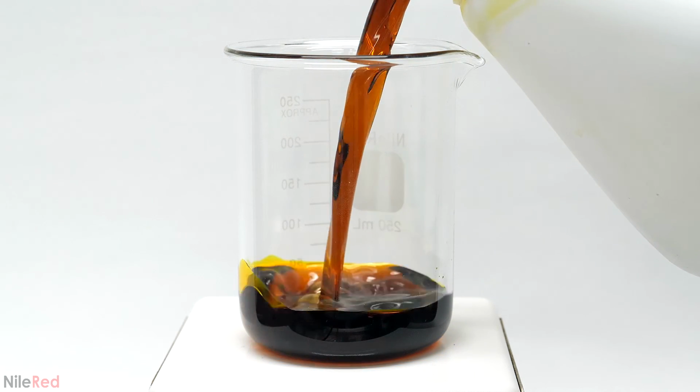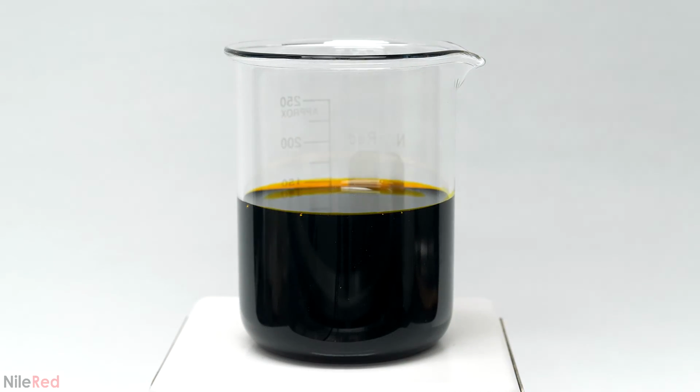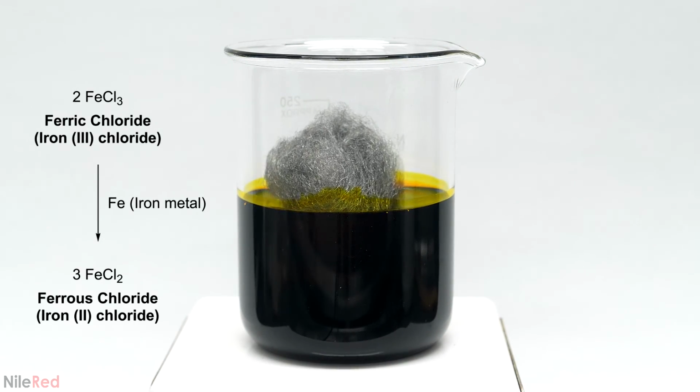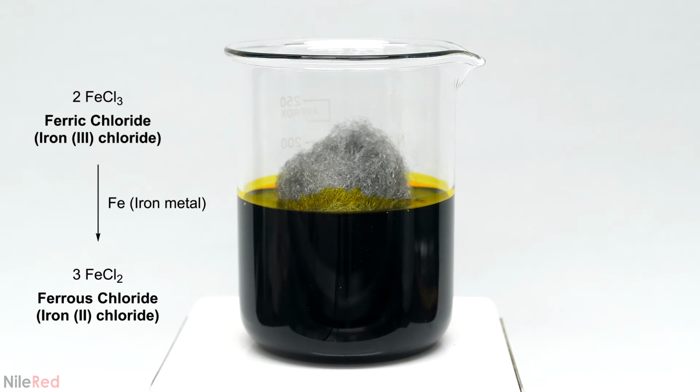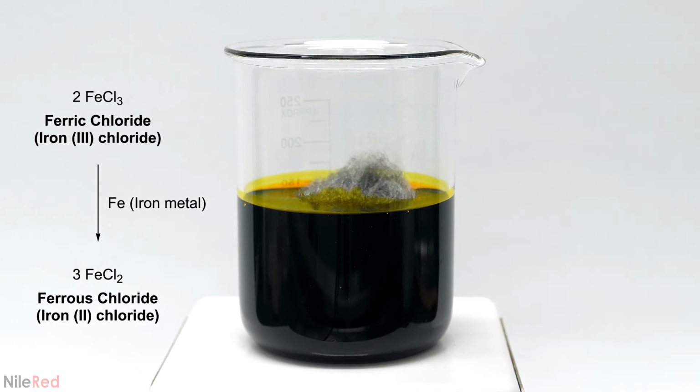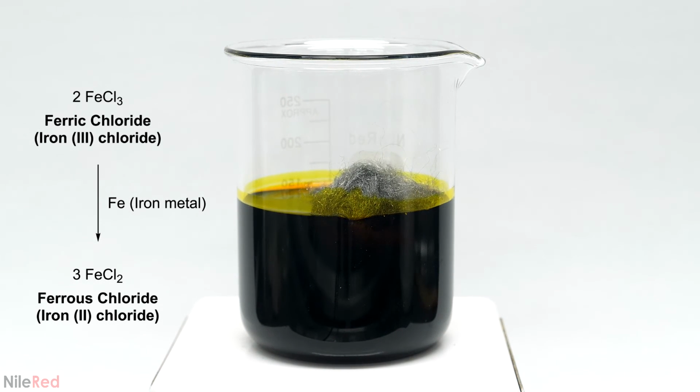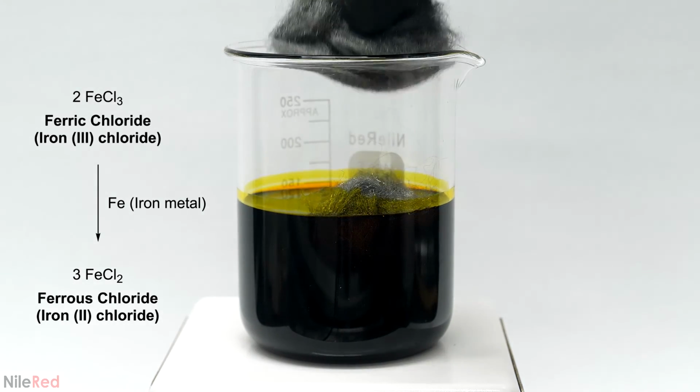So into a beaker, I poured in some of the ferric chloride, and I also dumped in some steel wool. It started reacting almost immediately, and the iron 3 was being reduced to iron 2. In doing so, 2 iron 3 ions were turning into 3 iron 2 ions, which meant that the concentration was increasing. A lot of procedures that I saw online, though, didn't take this at all into account, and they assumed that the concentration was staying the same.